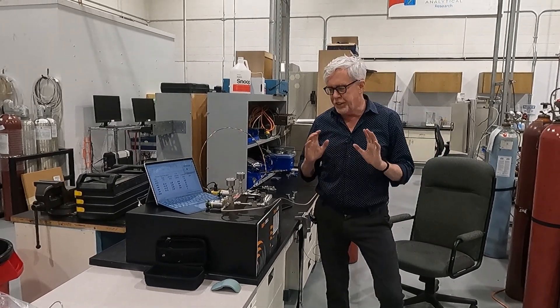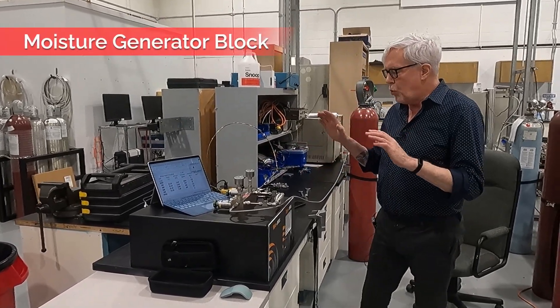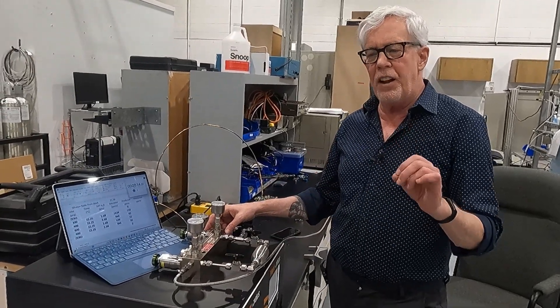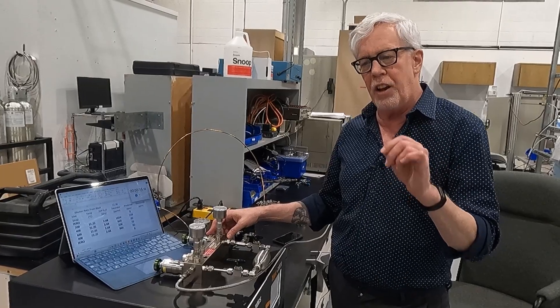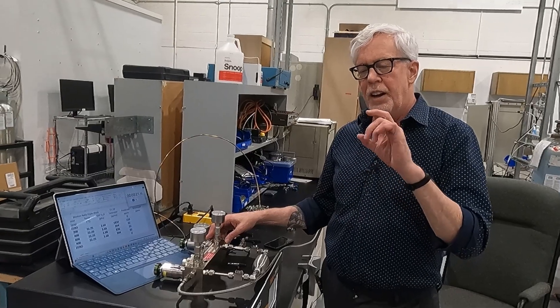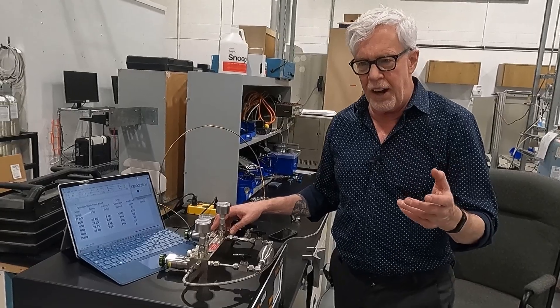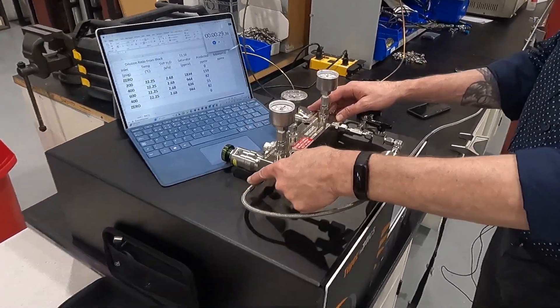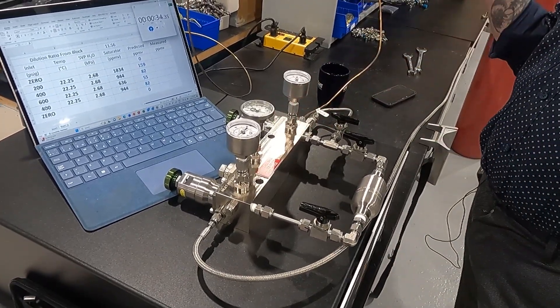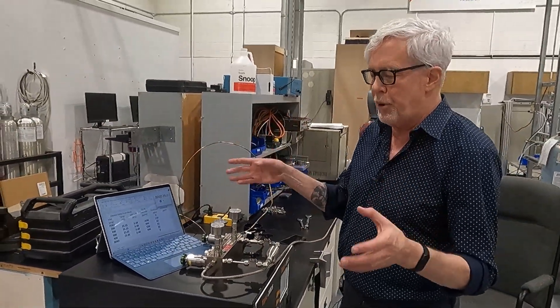Welcome folks. We're going to talk to you today about Insight Analytical's Moisture Generator Block. We use this moisture block to provide a validation source for your online or in-lab moisture analyzers. What it lets you do is generate a known concentration of water in a carrier gas of interest. We bring the carrier gas in here and we can use any carrier gas, whether it be nitrogen from a cylinder or natural gas directly from your pipeline.